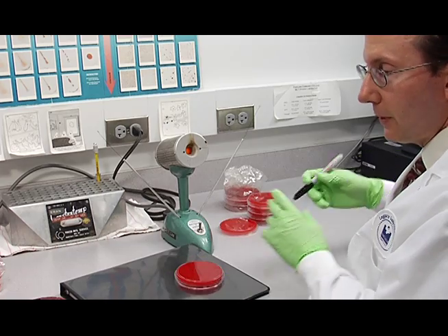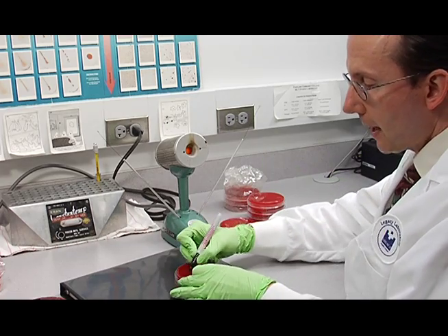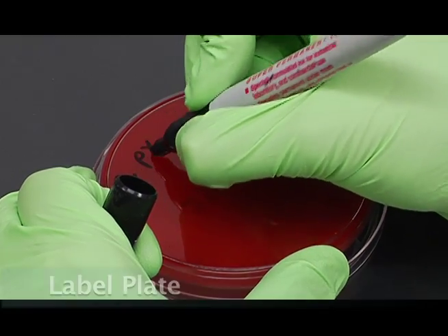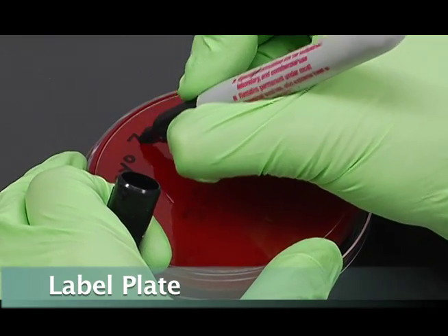To begin, label your plate for Streptococcus pyogenes. I'm just going to put S.pio on here as an abbreviation for that. And today's date.